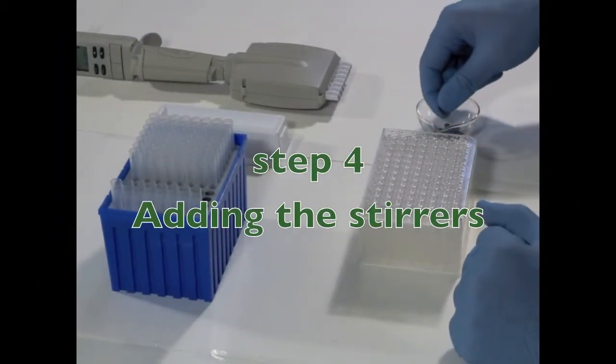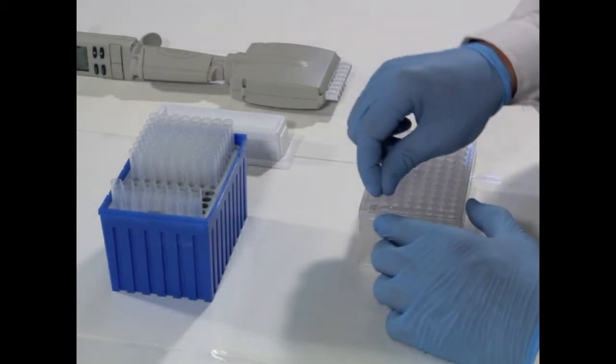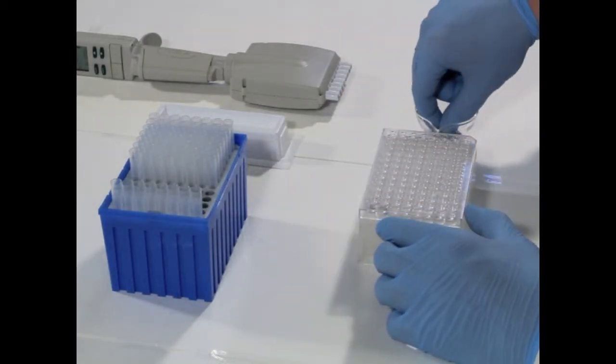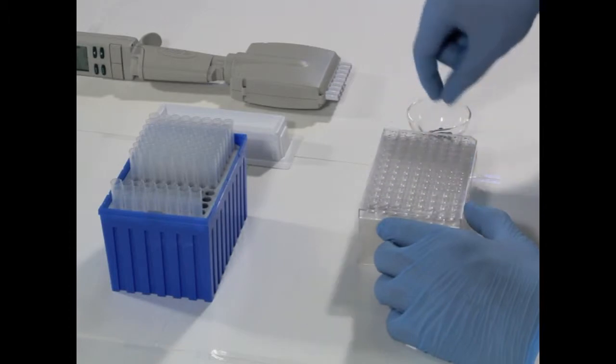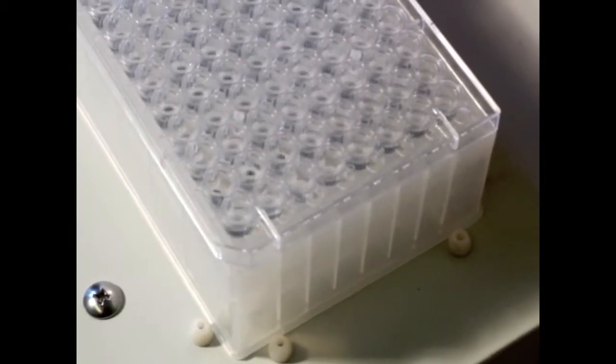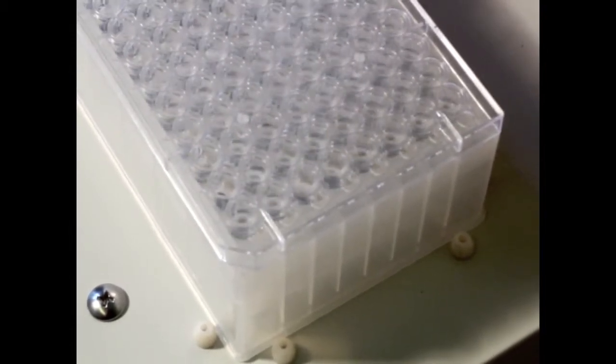Stirring discs can be added into each well manually as demonstrated or using a plate loader. Stirring is done during the whole incubation except for sampling.